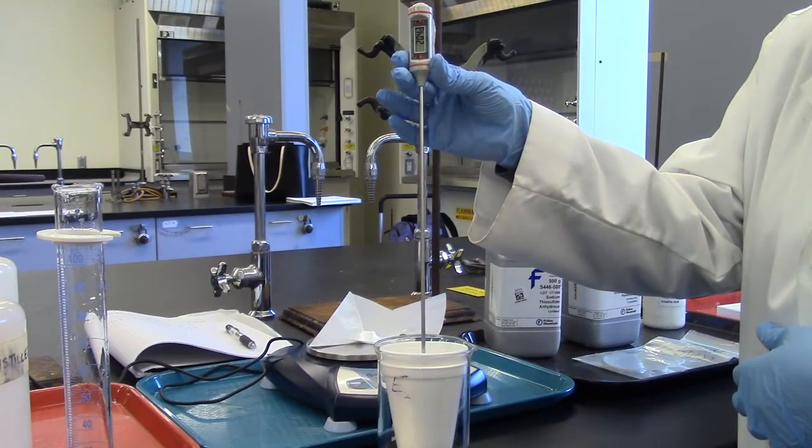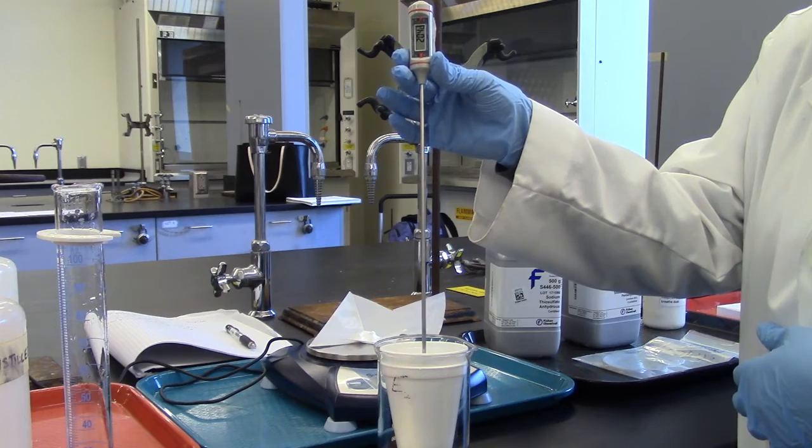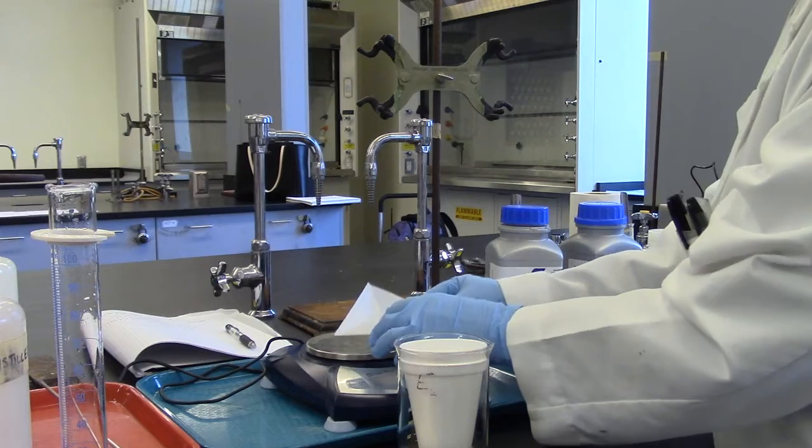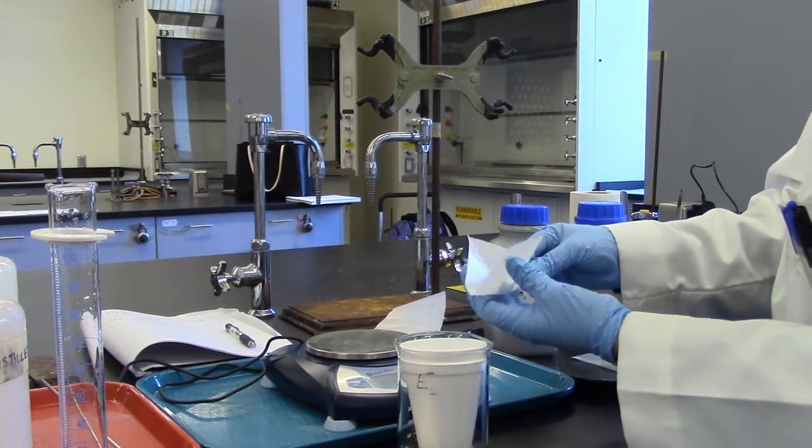Measure the temperature of the water and record it in your notebook. Now add the three grams of sodium thiosulfate to the calorimeter.